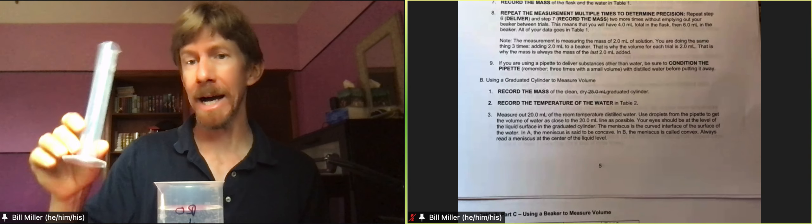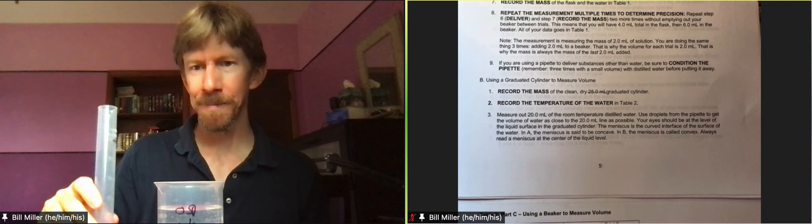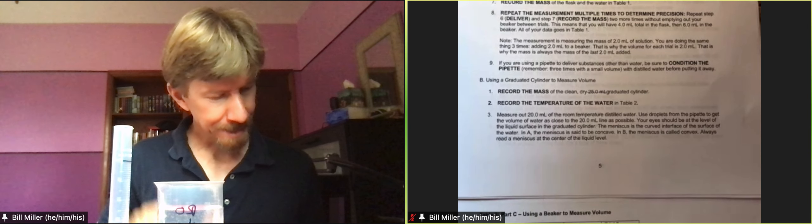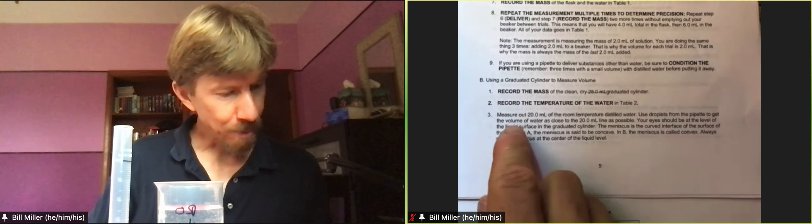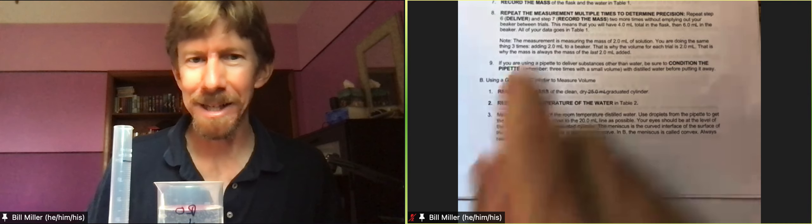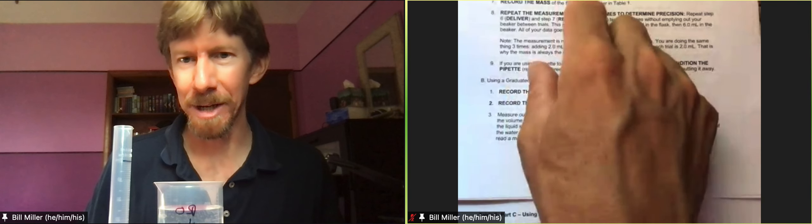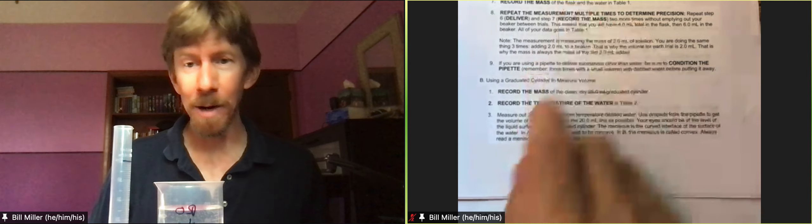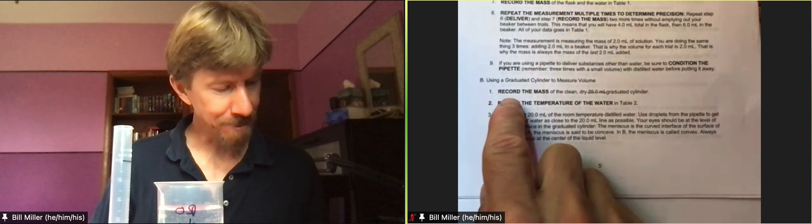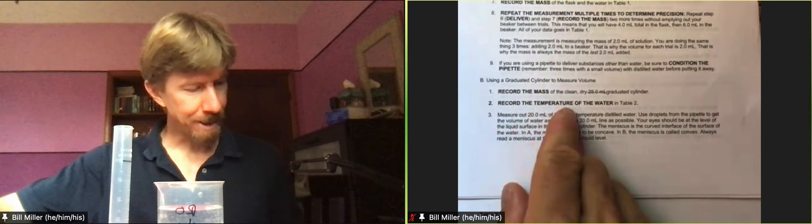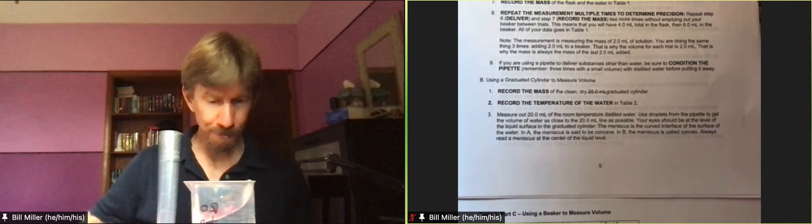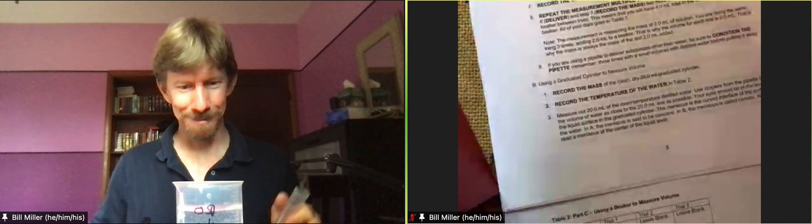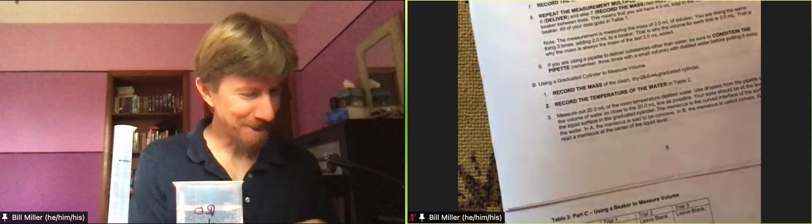I happen to have a 50 milliliter graduated cylinder with me today. I did forget in the last one to take a picture of my pipette, so make sure you do that. Now we're on the graduated cylinder. It says record the mass of a clean dry graduated cylinder, so let me get my scale out.